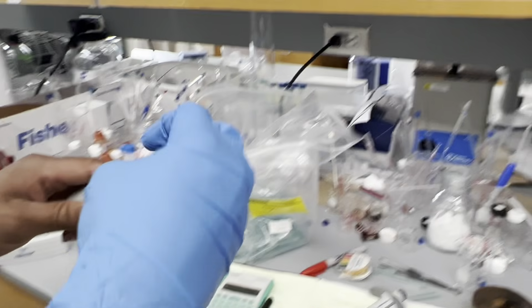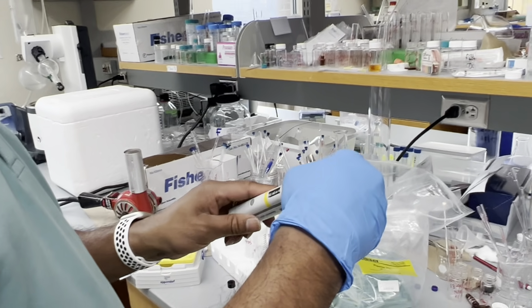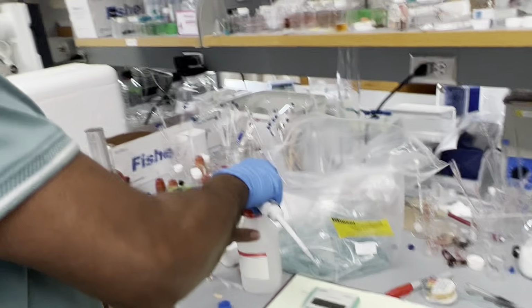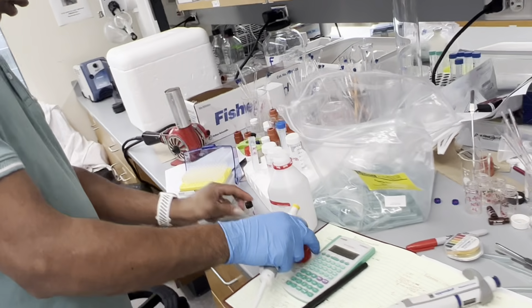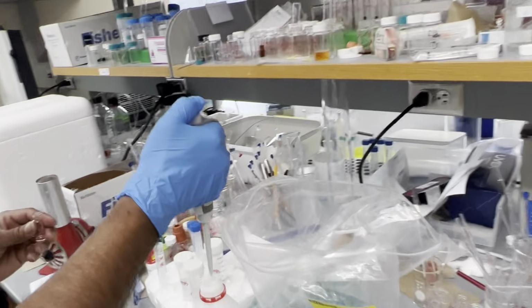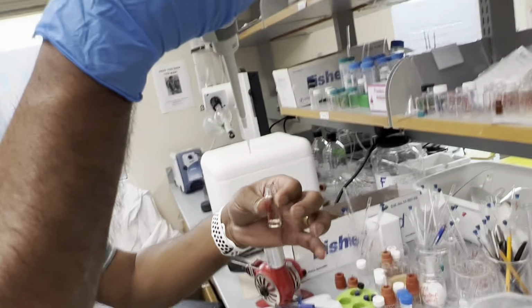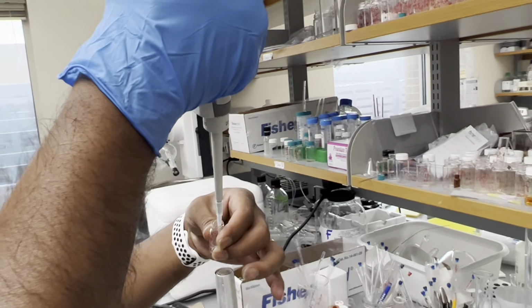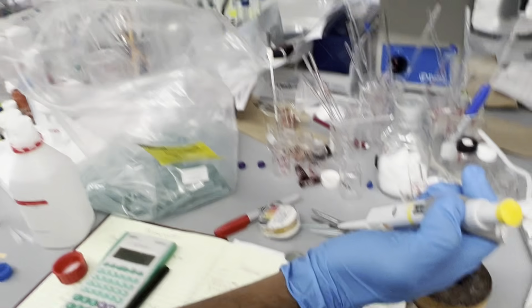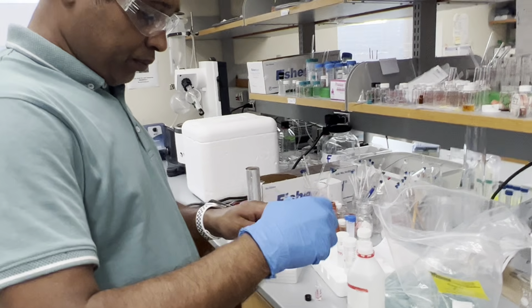So here I'm going to adjust. That is 20. Now 10.